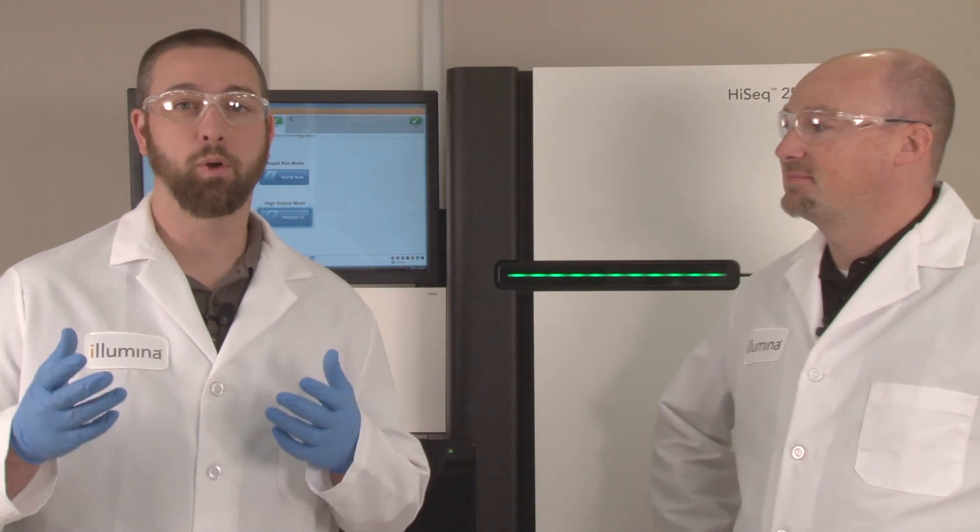In creating this resource, we polled numerous Illumina field application scientists and field service engineers for their advice and tips on running the HiSeq. The information collected and highlighted in these videos represents the sum of many years' experience of HiSeq support gained at customer sites ranging from large genome centers to small research labs.